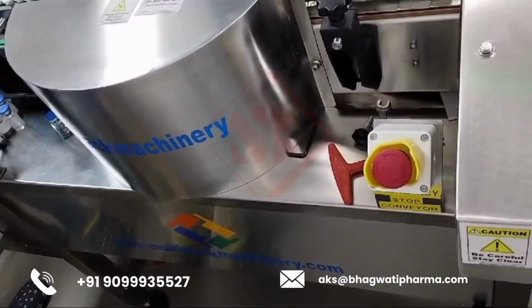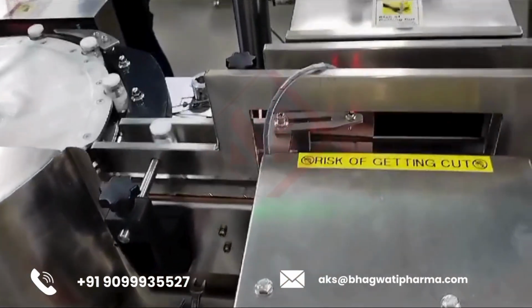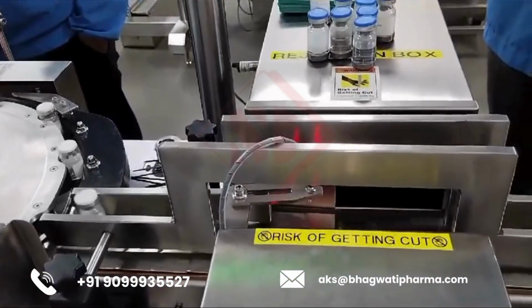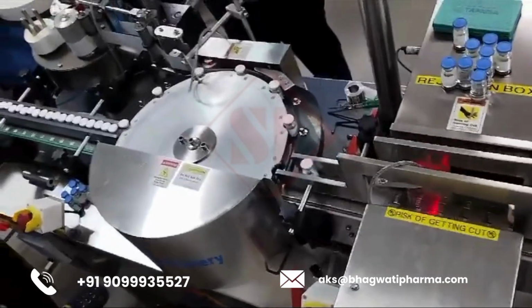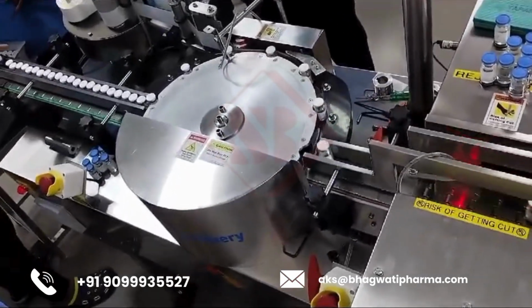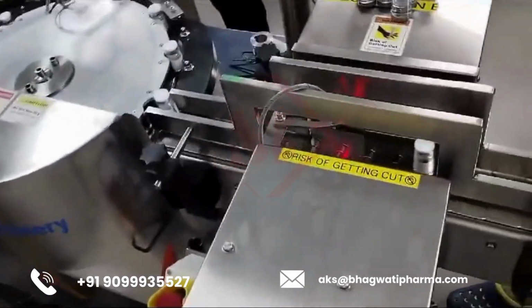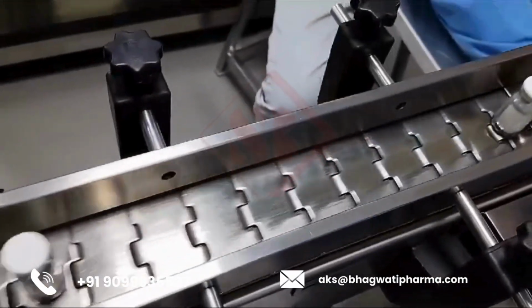Vision inspection. As the vial moves forward, the vision camera captures images of the labeled vial. Quality check. The inspection system analyzes the images for label accuracy, positioning, and readability. Rejection of defects. If any defects are detected, the machine automatically rejects the faulty vial by diverting it from the main production line. Collection. The correctly labeled and inspected vials are collected at the end of the conveyor system.